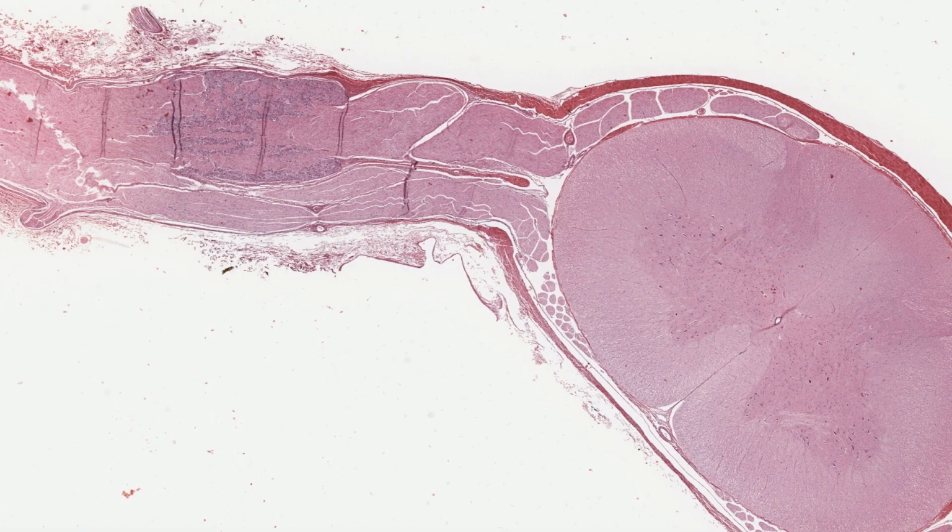I think it's worth you observing how neurons and glial cells of the spinal cord appear with conventional hematoxylin and eosin staining that you are probably used to viewing in your histology laboratory classes. This section is not quite in the best orientation, but just tilt your head to the right and look at it. The white matter is here, and the grey matter is here. Here is the dorsal horn and the dorsal root.